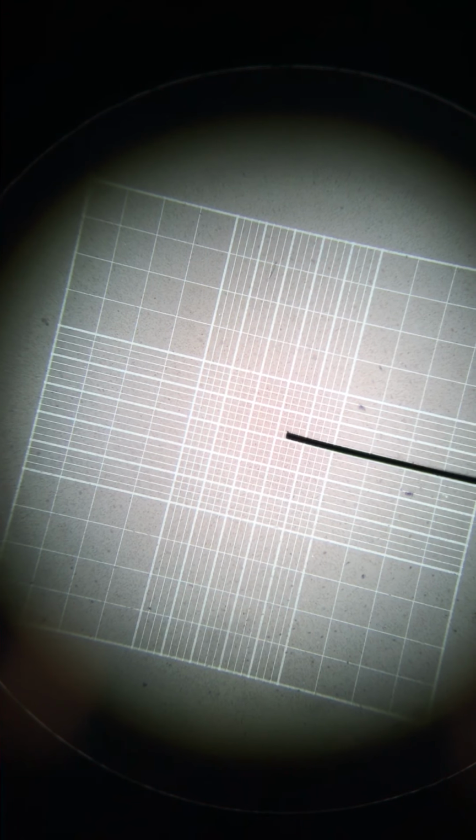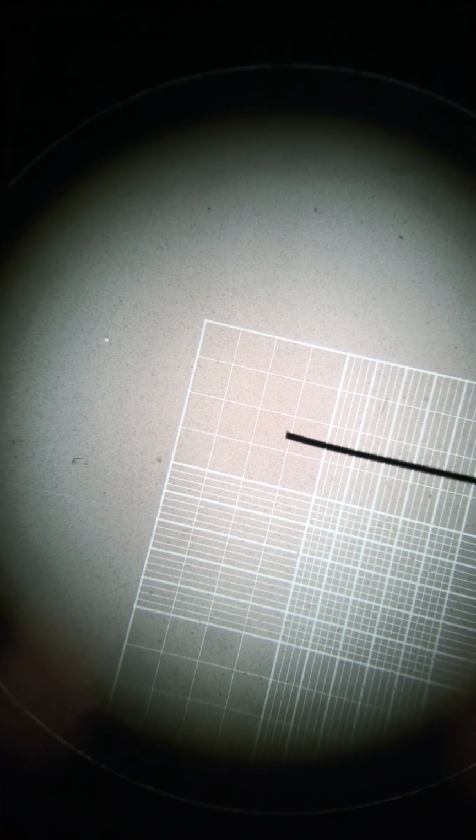So I've already done that. As you begin to focus, you should be able to find this square grid pattern. This is the actual counting chamber itself, and as you can see, it is divided into a number of smaller and smaller squares. There are 9 large subsquares, and then each one of those is divided into smaller sets according to different dimensions. These outer ones are subdivided into 4x4 grids. The center square, however, is divided into a 5x5 grid.